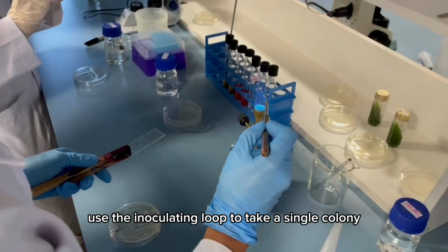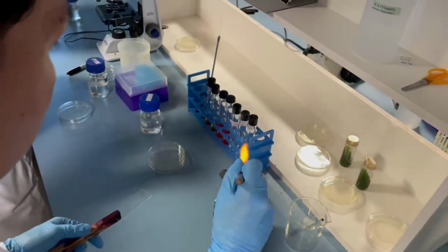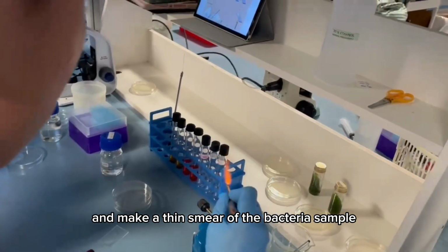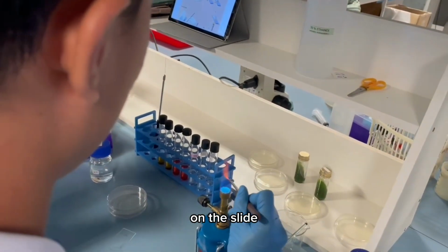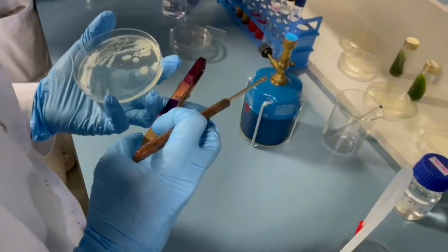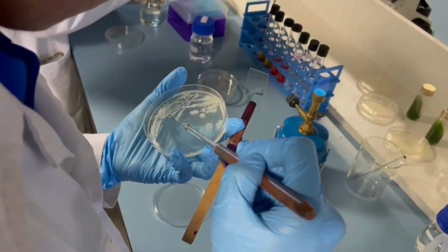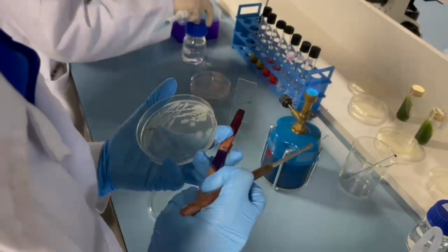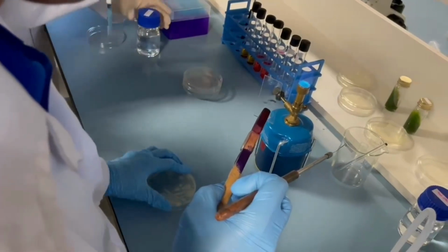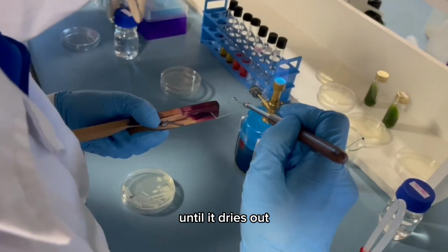Use the inoculating loop to take a single colony to transfer to the glass slide and make a thin smear of the bacteria sample on the slide by making a circular motion. Please make sure to do the circular motion until it dries out.